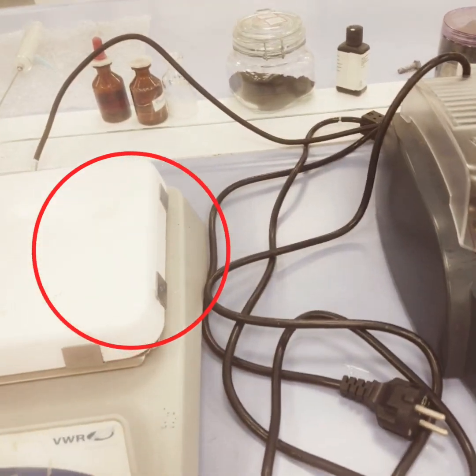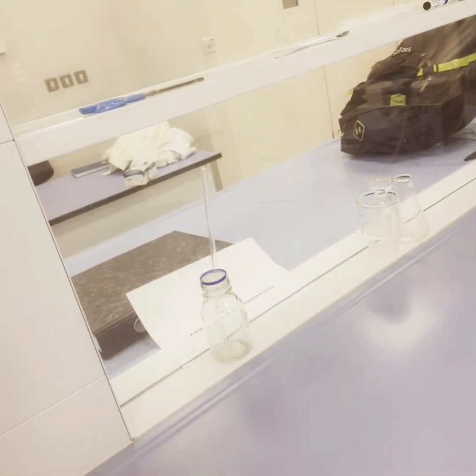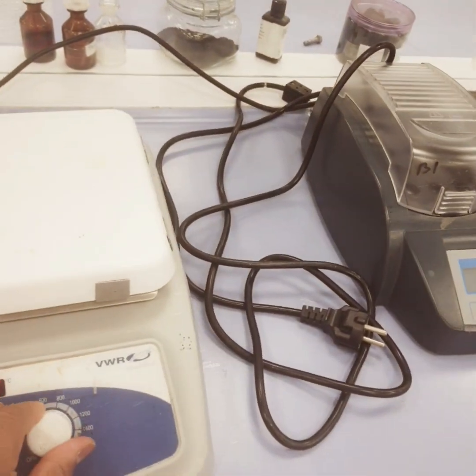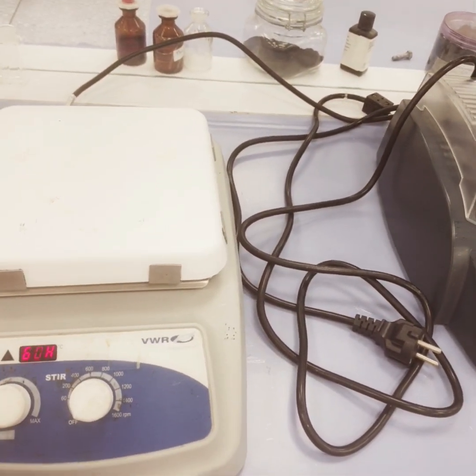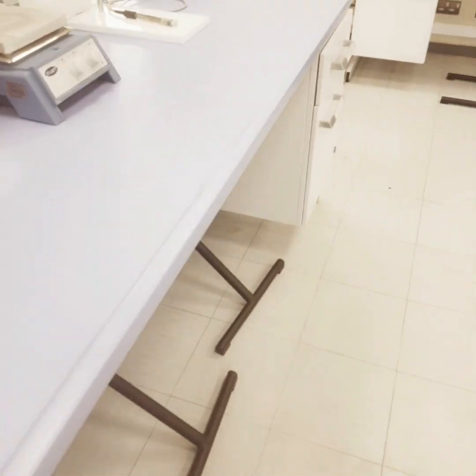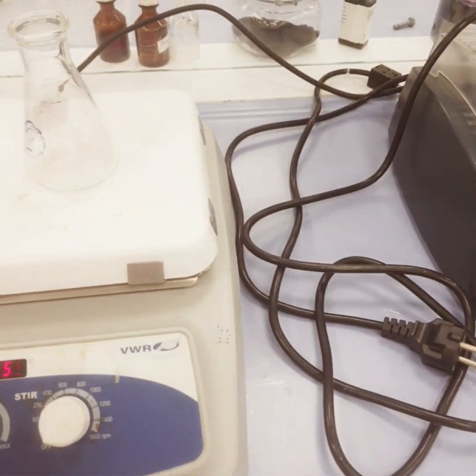Hello friends, in today's video we will learn a simple thing about how to use the hot plates. Usually the hot plates are used for uniform mixing of liquid, or you can say for even heating.